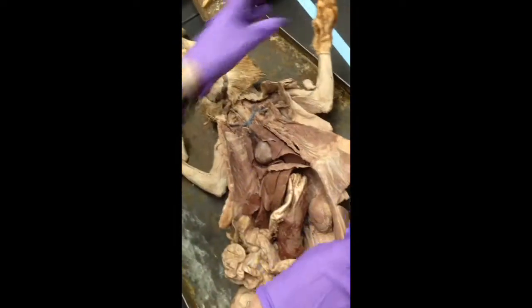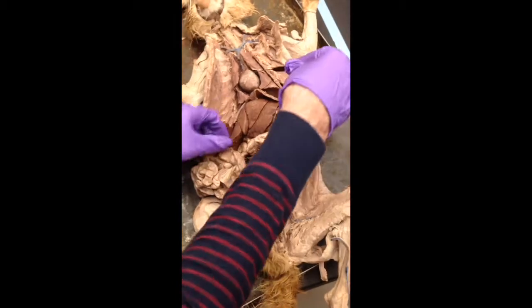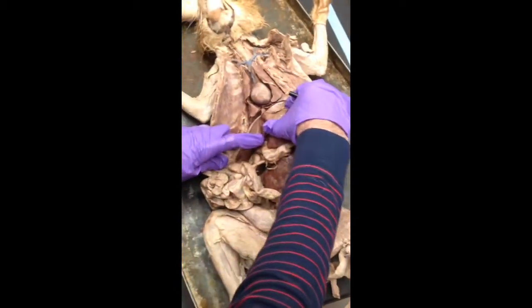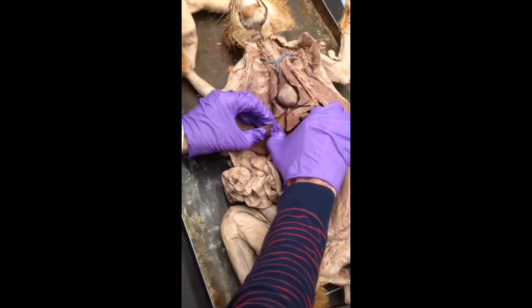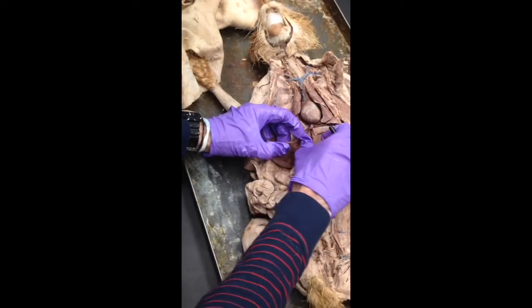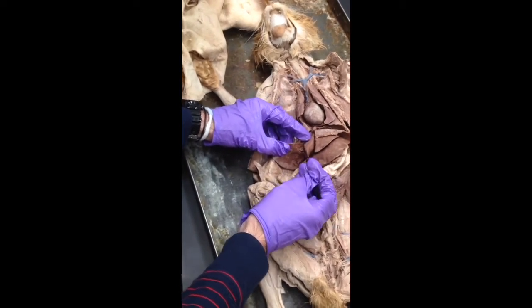Okay, it's going this way across there, and there's the external jugular. So, just for completeness, there it is. There on the outside. All right, heart, lungs. There's the diaphragm, the liver. My gallbladder, I believe, is way down in there. On one of these lobes. So the gallbladder is way down in there, but it is there. Right, and it's that little pouch there.